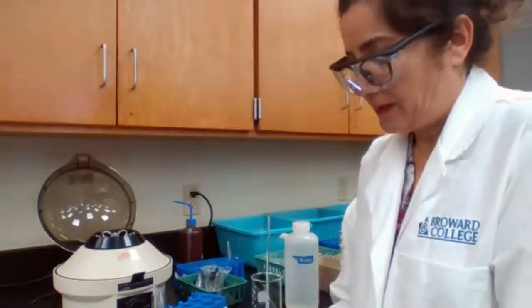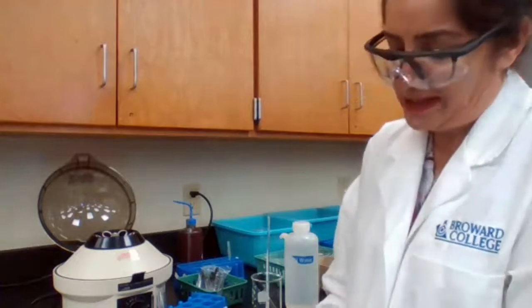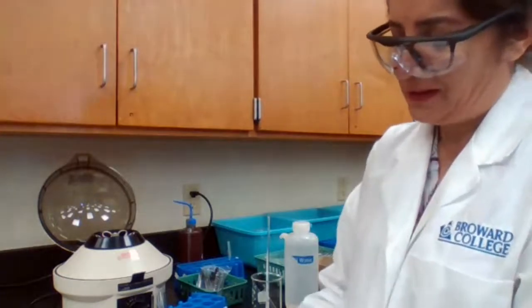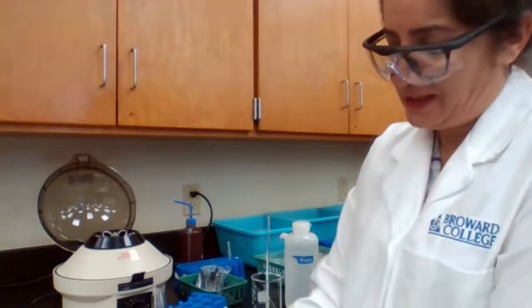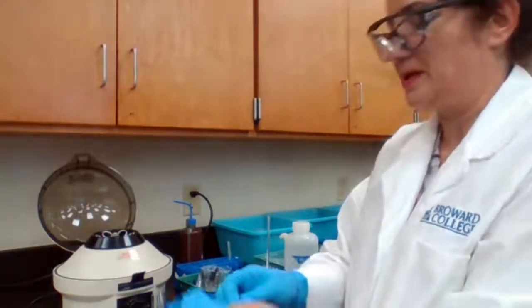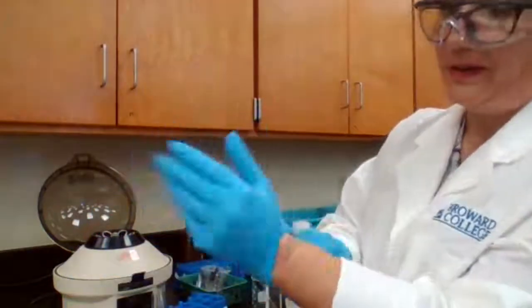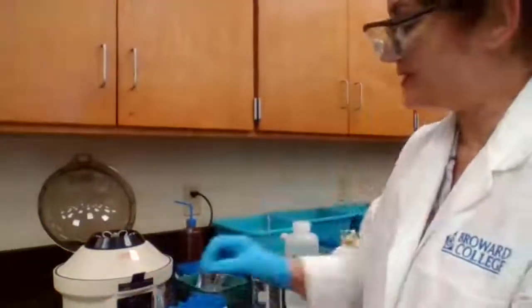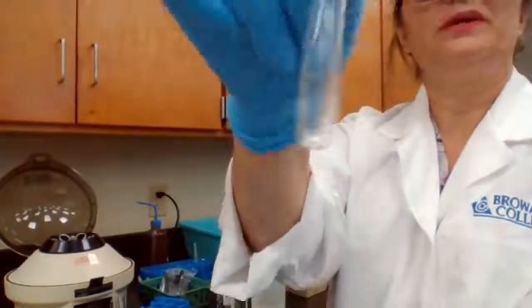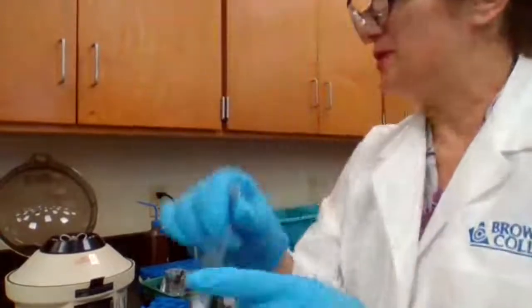Okay, so which test tube? What do we have? What do we have for silver at this point? Is the silver chloride in solid form? So silver chloride in solid form, because when we added the hot water, we had some white precipitate left in the test tube, and that is supposed to be the silver chloride at this point.